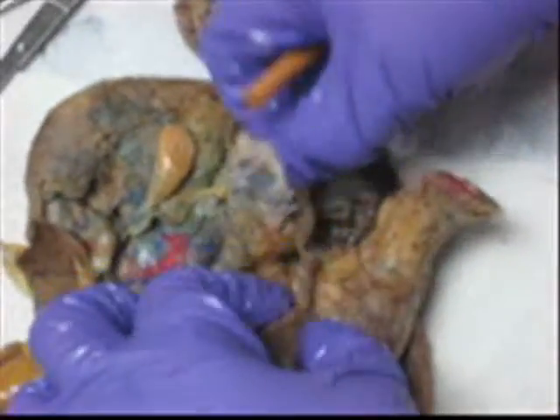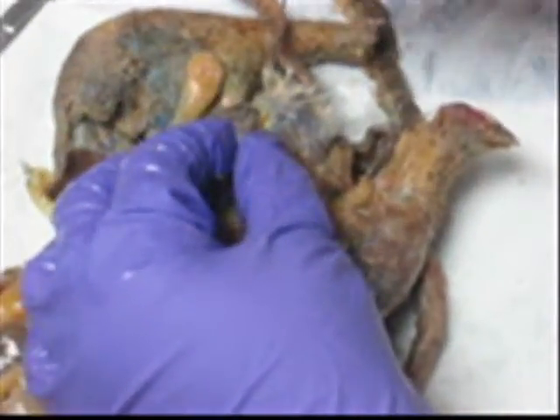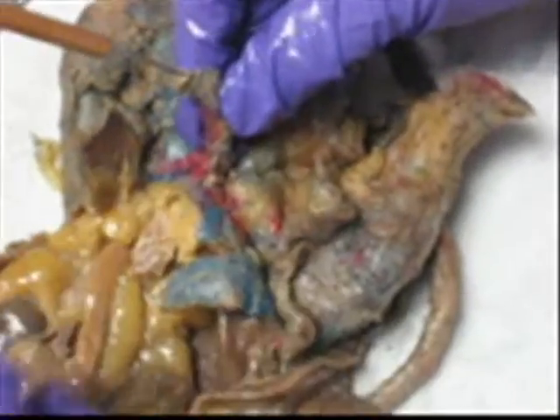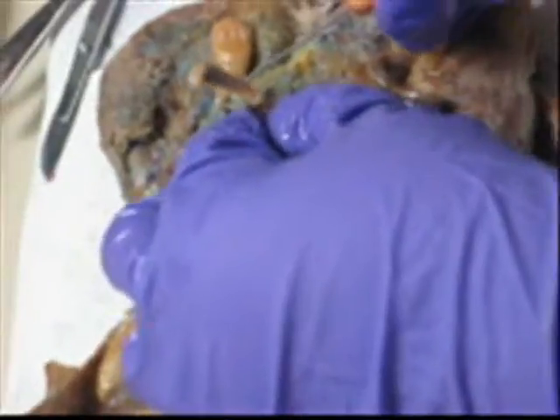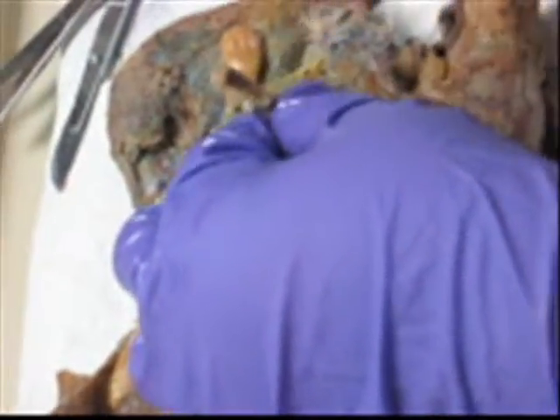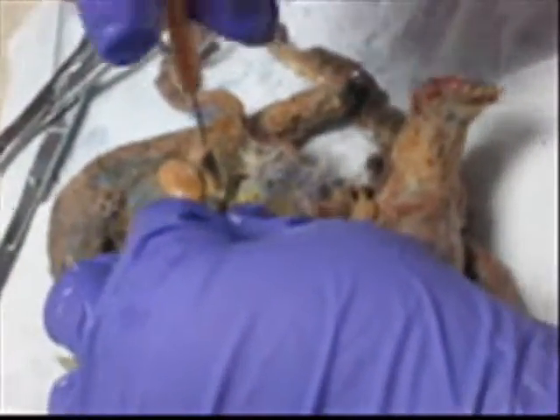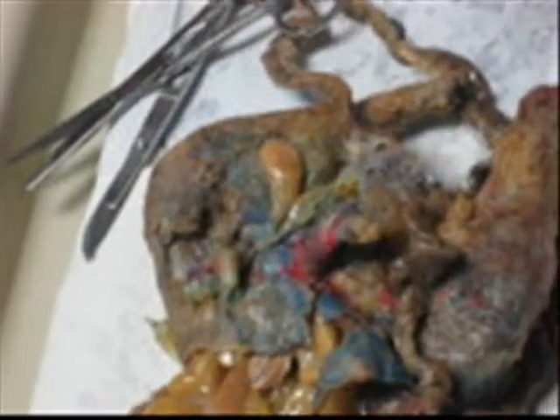And then in the penis, urethra. Down the center of the baculum, you see the opening? That's also urethra. If I pin the bone, then it's the baculum. If I pin up at the top, hook of the baculum. If I pin down the center, urethra. That's it.